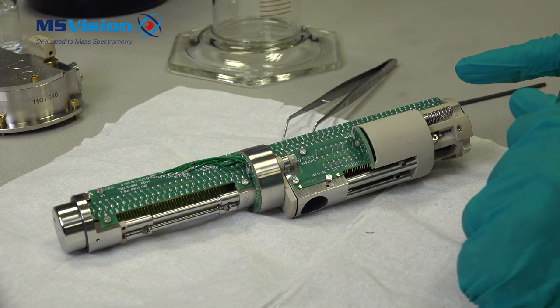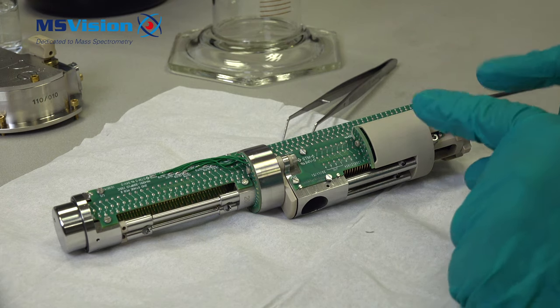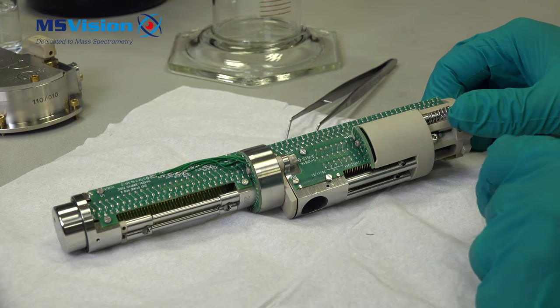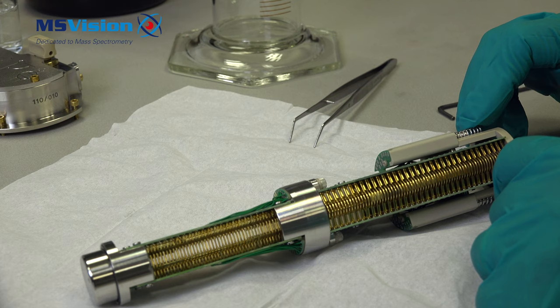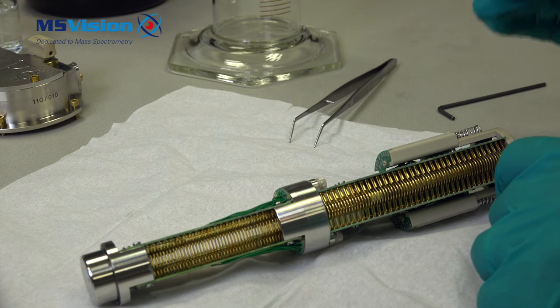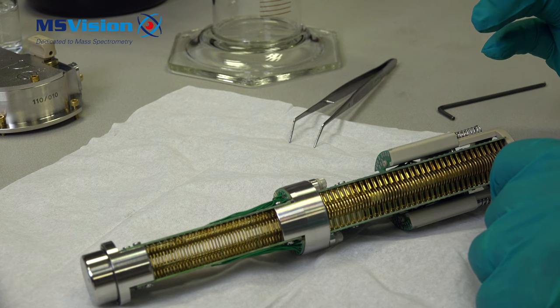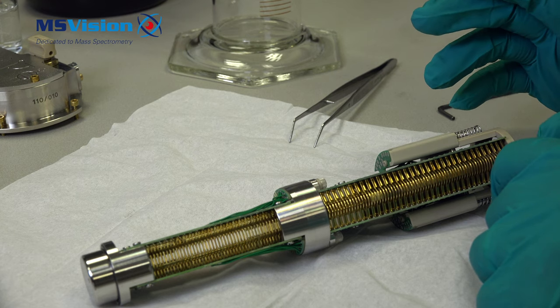You can see the PCBs and wires, so cleaning using acid or water is not allowed. We will clean in methanol only. There is an extended cleaning method using a soap solution, but this is reserved for engineers. For the customers, it is advised to only use methanol for cleaning.